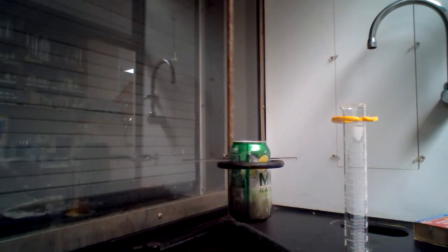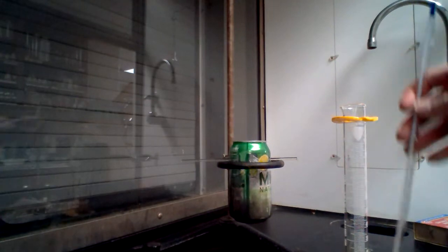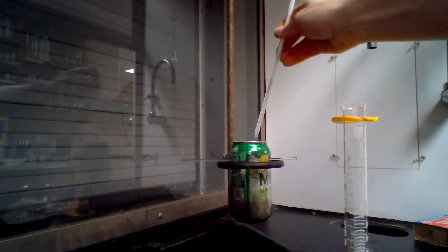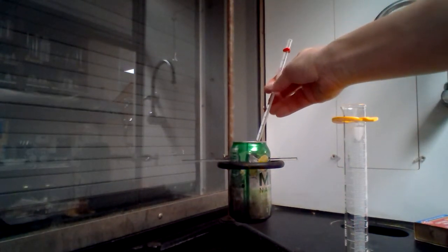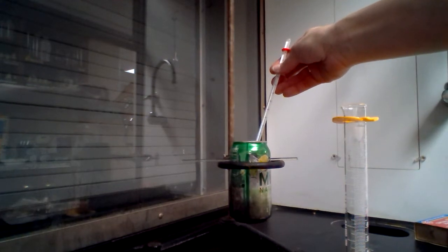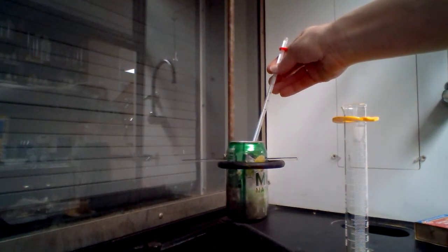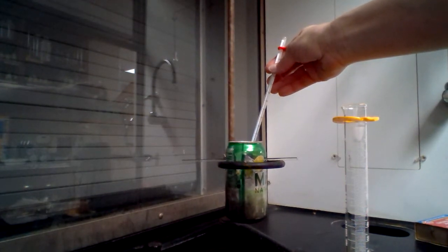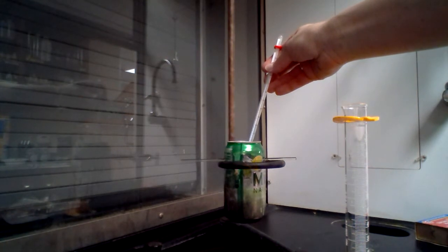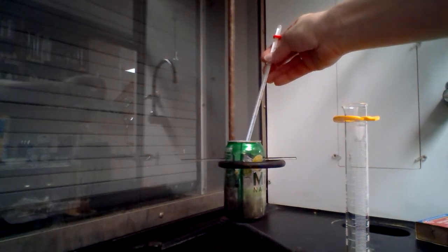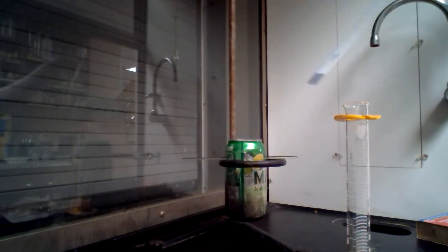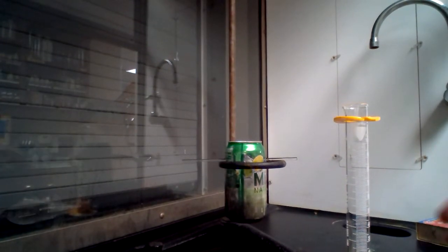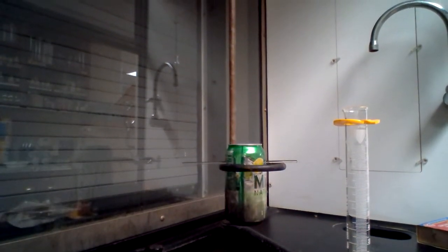After that, what you're going to do is take your thermometer. Take the temperature of the water before you start the lab. Take note of the temperature and write that down. It should be about room temperature, which is approximately 25 degrees Celsius. Take the thermometer out and then your lab is ready to go.